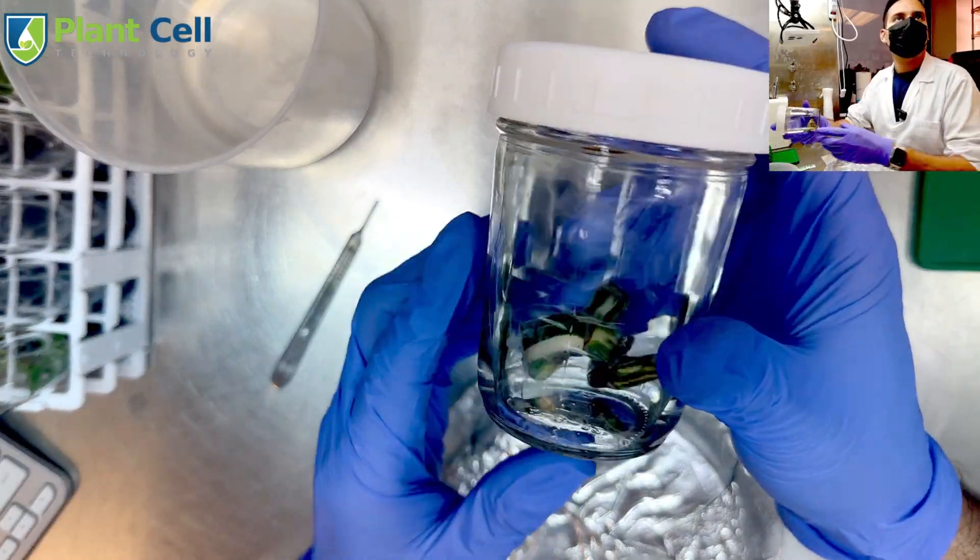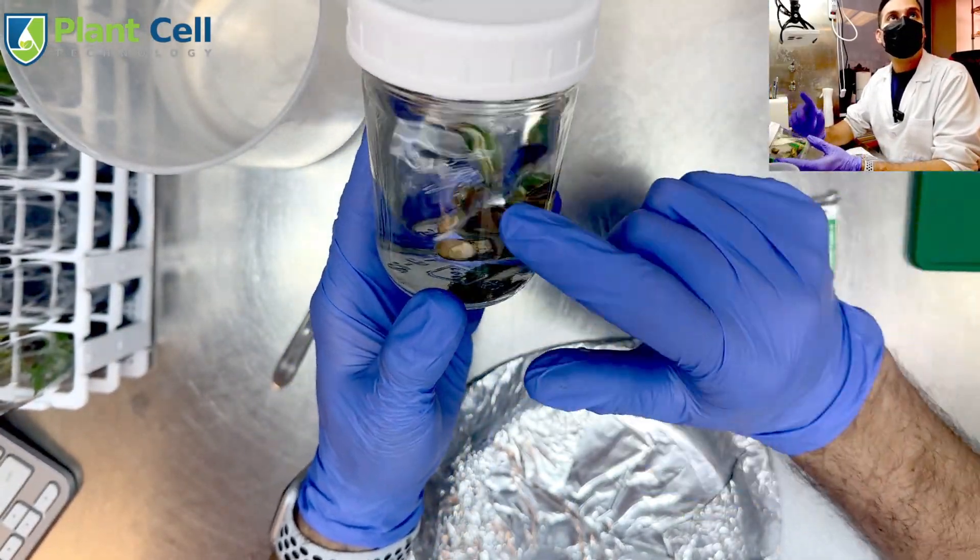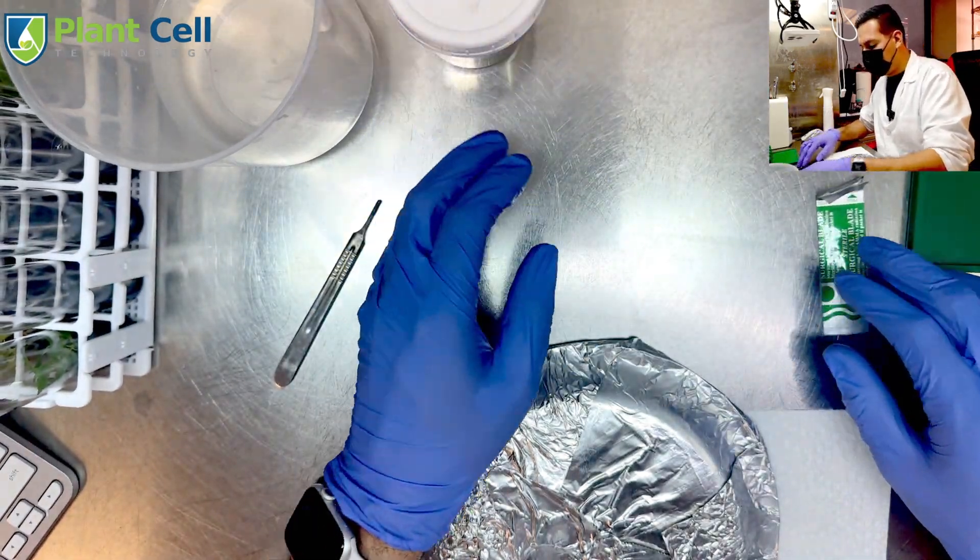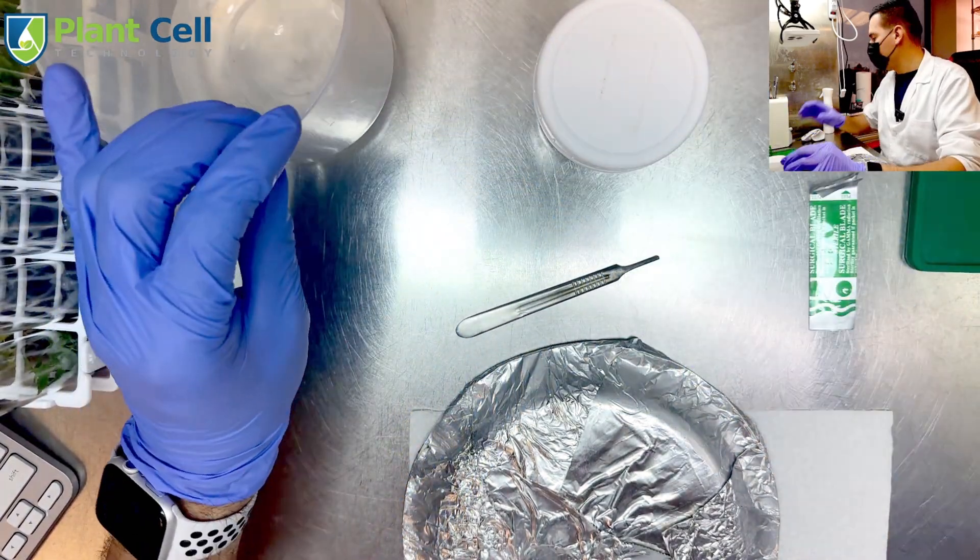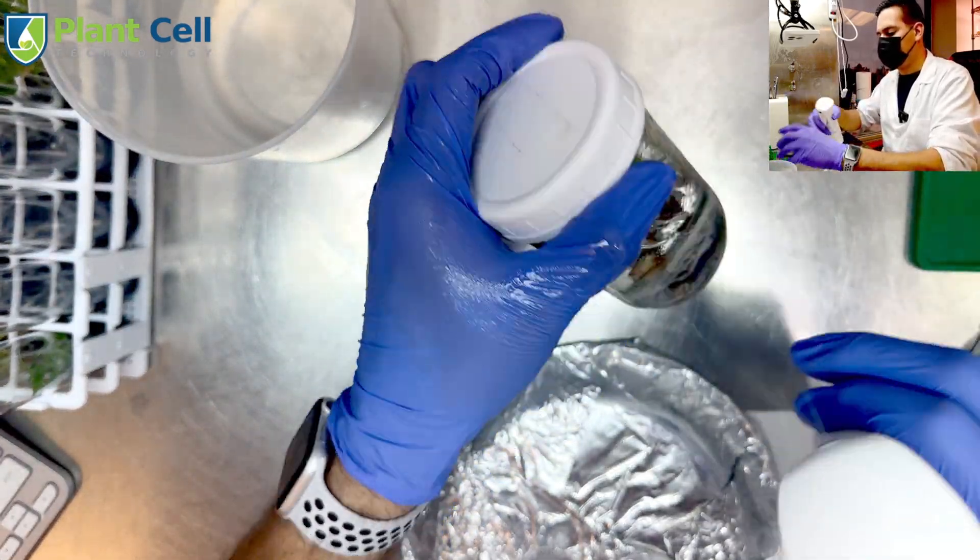Alright, I have rinsed the plants three times using sterile water. Now it's time to cut them, so the first thing that I want to do is get rid of this extra water that I have.